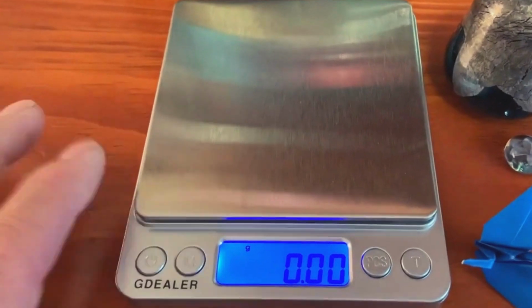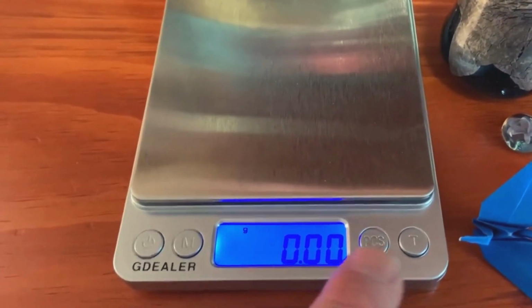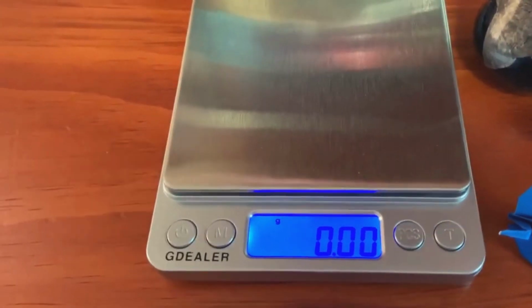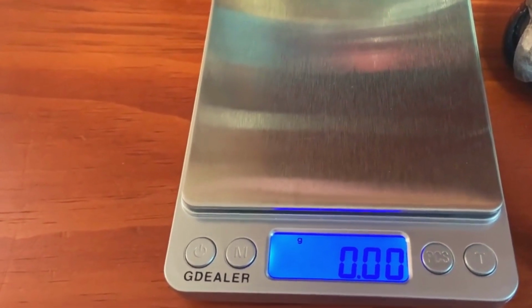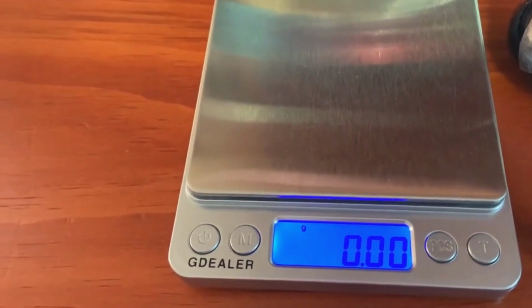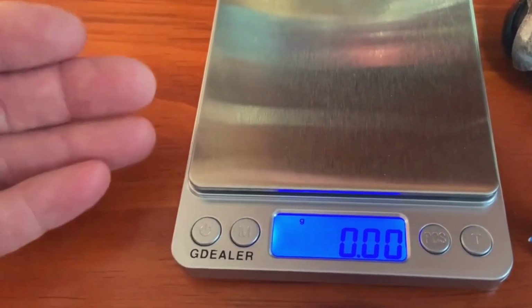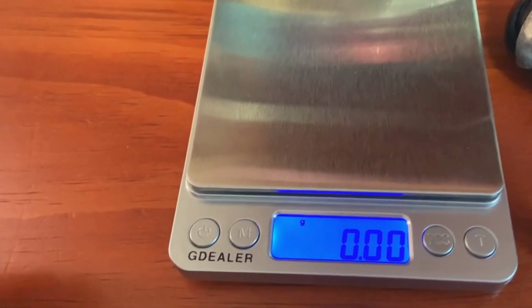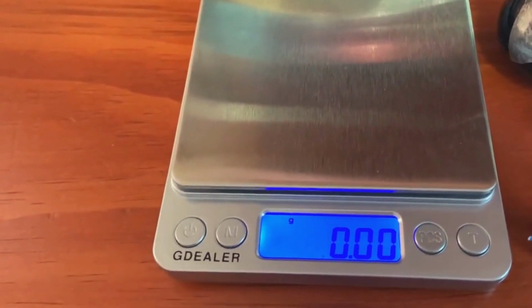Now, second of all, when nothing's on the pan and the reading is zero, it's considered to be zeroed, okay? And so we need to make sure before we do every measurement that, in fact, this is the condition of our balance. Otherwise, some material left on the balance could somehow affect my mass value.